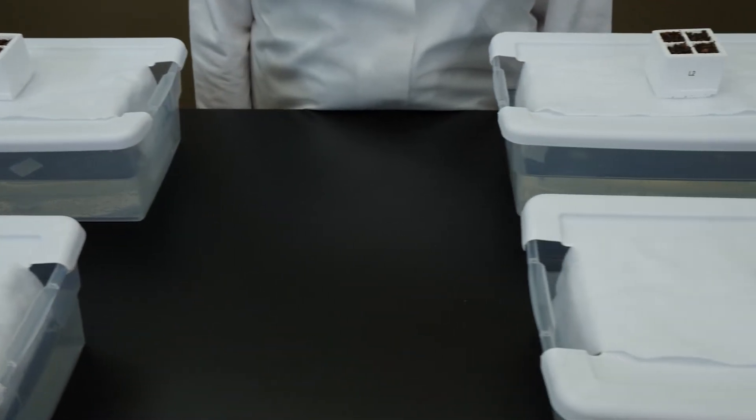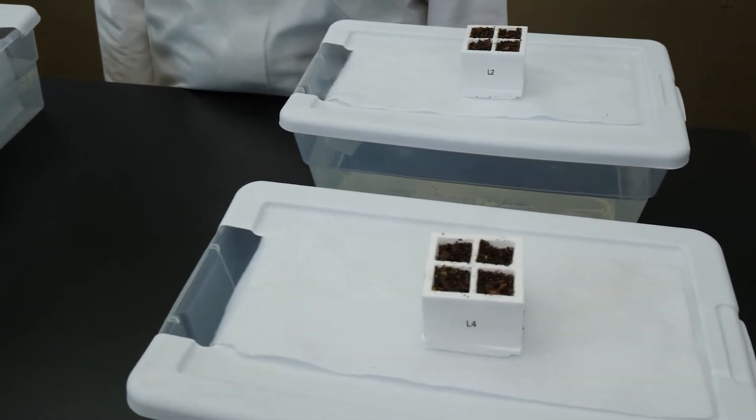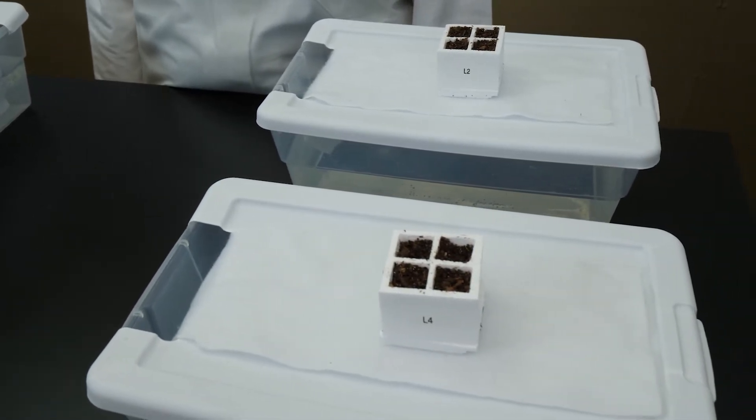We will record our observations, such as the size and color of the leaves and stems, and we will record the average height of the plants. Since the metric system is the universally accepted system for laboratory experiments, we will measure the plant height in centimeters. We will use four groups of plants. Each group of plants will receive the same amount of water and nutrients, but the amount of light will vary.